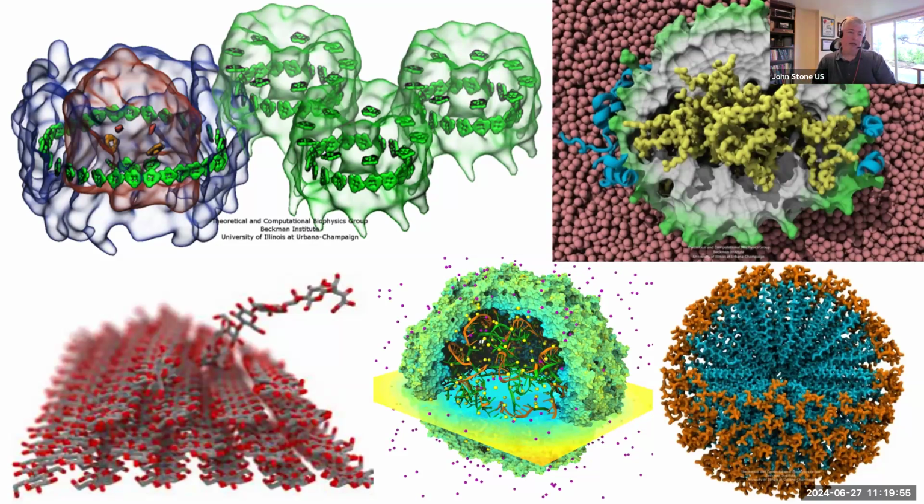In the bottom left, I made a very exaggerated scene. This is one that one of our friends, Josh Vermas, made for me originally. And this is showing off what is called depth of field. So that's where, much like with a camera, you can choose what is in focus and what is out of focus. A camera has a plane of best focus front to back. That's another way of showing context, but drawing the viewer's attention to a particular part of the structure. And so I'll show some more examples of that as we go on later.